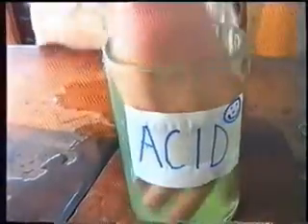It can lead to absolute terror. There's danger from flame. From corrosive liquids. From electricity.